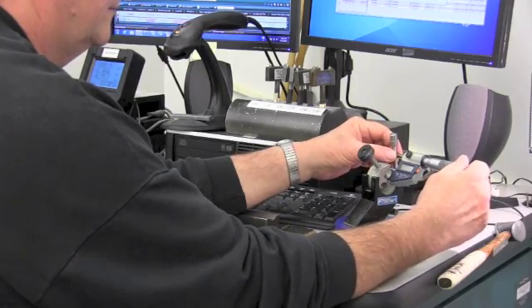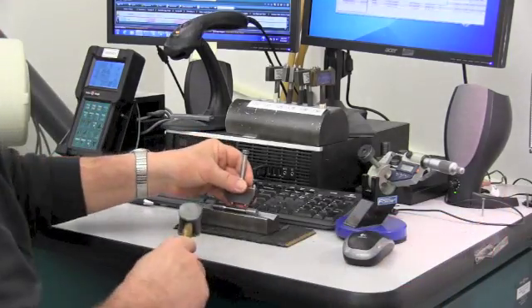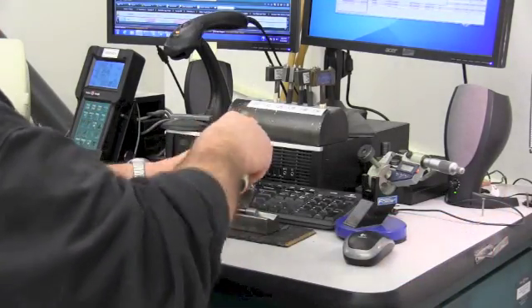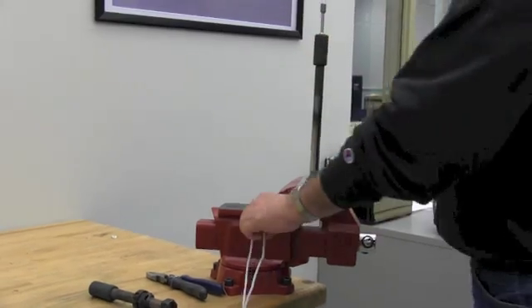After measuring the specimen diameter and marking the gauge length, the technician then threads the specimen into high temperature nickel alloy threaded fixtures which will be used to attach the specimen to the tensile machine.